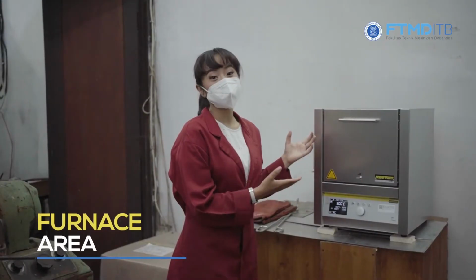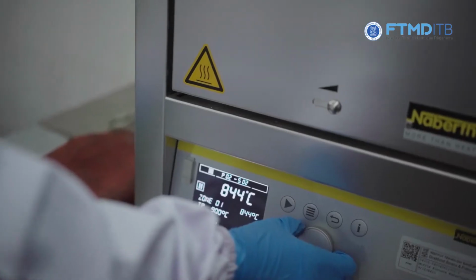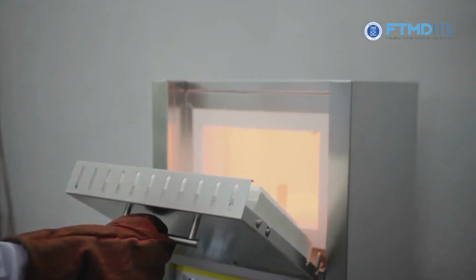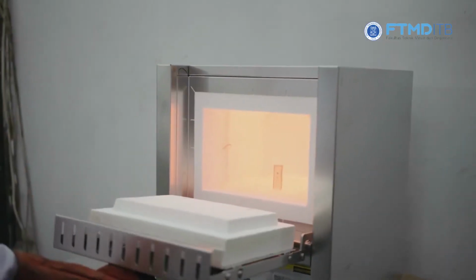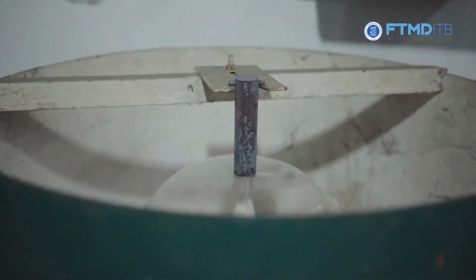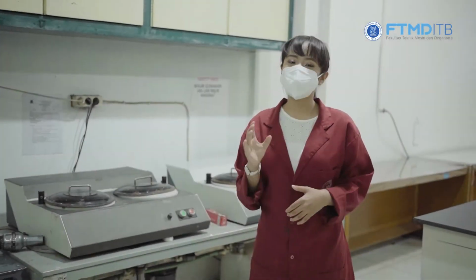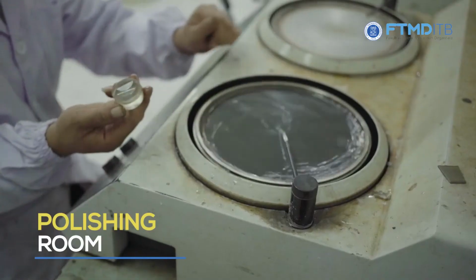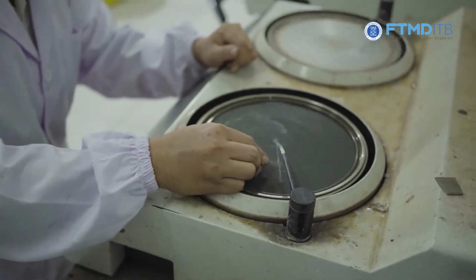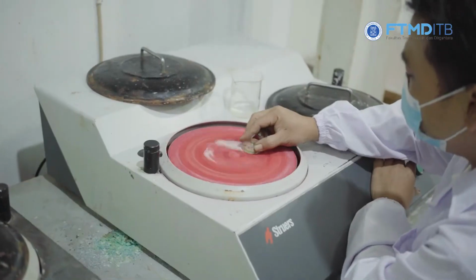Now, we are in the furnace area where several heating furnaces with different temperature limits can be used based on our need. These furnaces can be used in the process of heat treatment of materials. We also have the Jominy test equipment used to determine the hardenability of the materials. Now, we are in the polishing room. As the name suggests, here students can carry out grinding or polishing processes for metallographic activities.